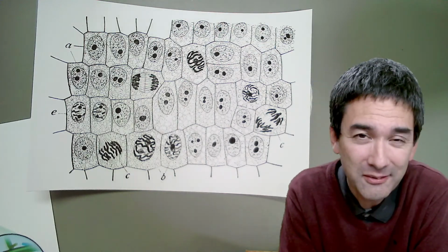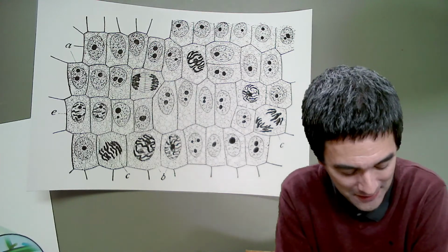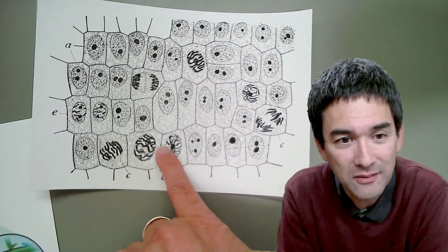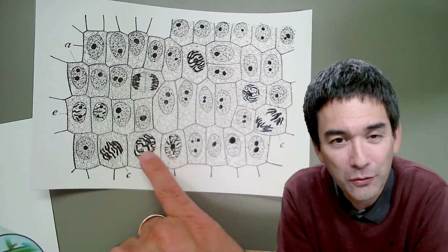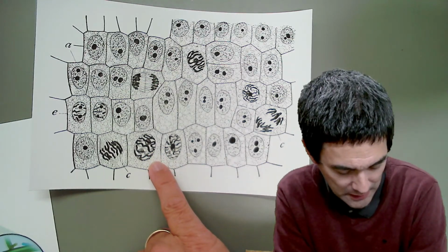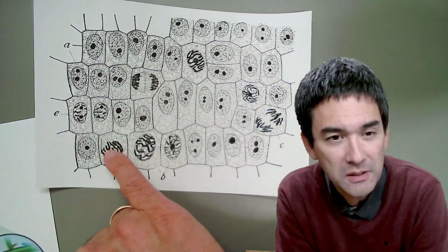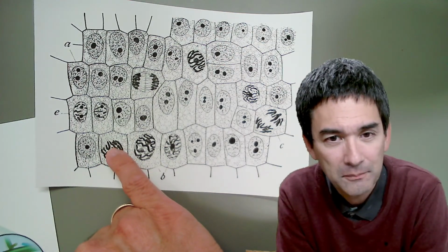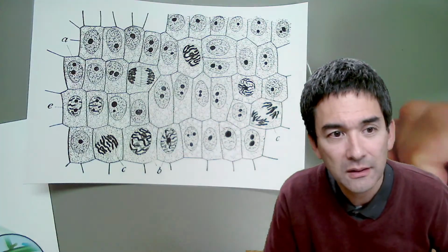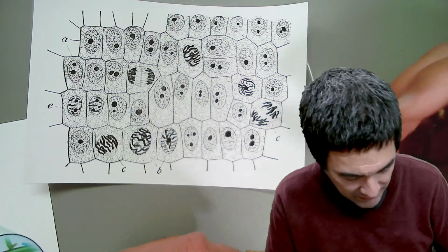But then again, it's sometimes surprising how many details you are able to see after all. So for example, this here, that's a prophase cell. You see that the chromosomes are starting to form. Then where is a metaphase? I don't know if there's a good metaphase diagram here. Actually, not a very good one. Maybe this one could be seen a little bit as metaphase. This one is very clearly anaphase, where they are pulled apart to the poles. And I do not see a very good telophase one, where it has divided.